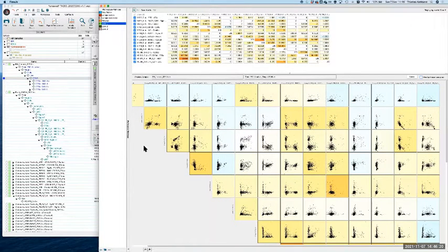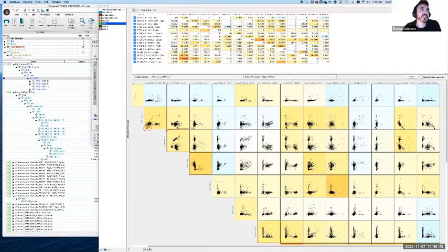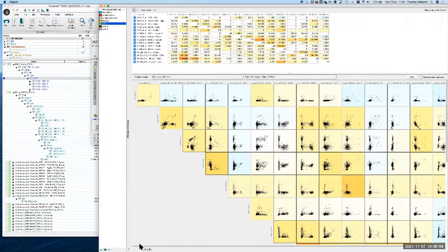I was going to say the second column along, there seems to be what looks like some overcompensation down there. No, pretty much just a negative happening in that. Sorry, the first channel. If you go back to the first, can you move your thing? Actually, yeah, let me, I got it. So tell me where to move the little pencil, and I'll put it in the right place. No, can you move the whole plot to the right, just so we can? Oh, I'm sorry. I see what you mean. First channel. So I'm guessing that's going to show it. You can see some super negatives in that first. Got it.